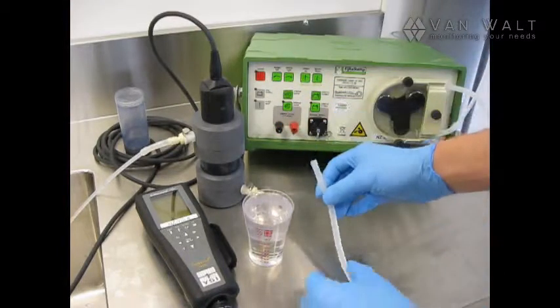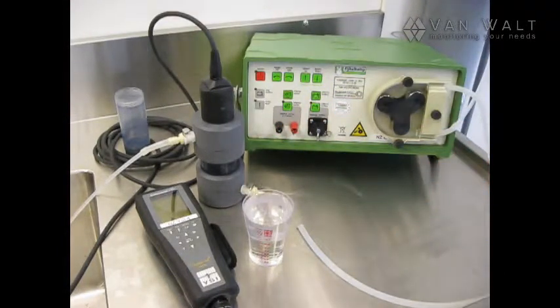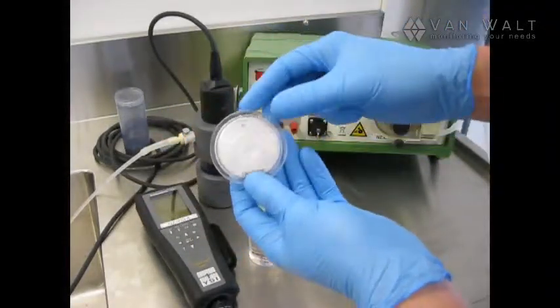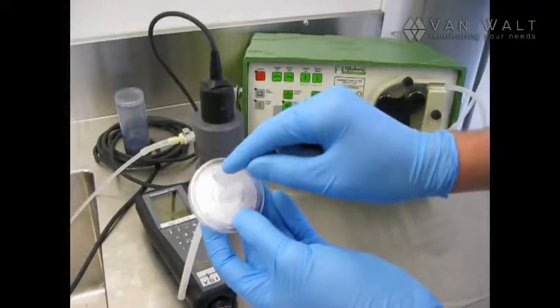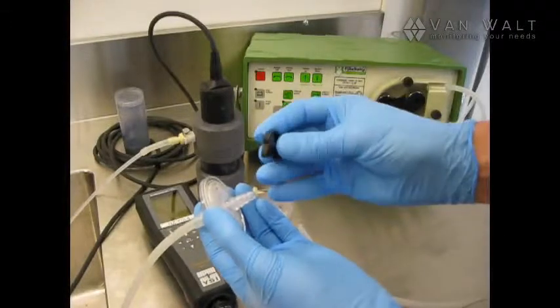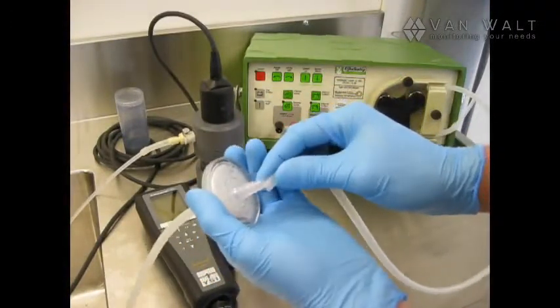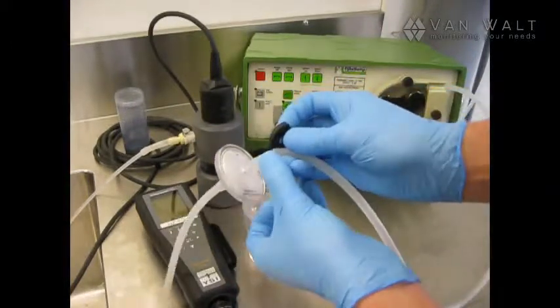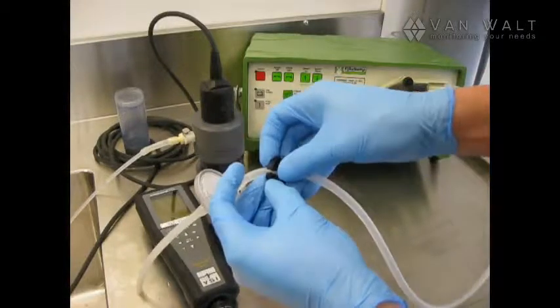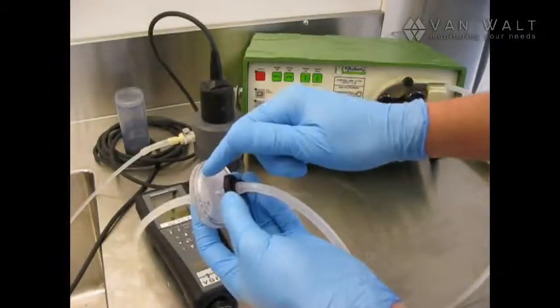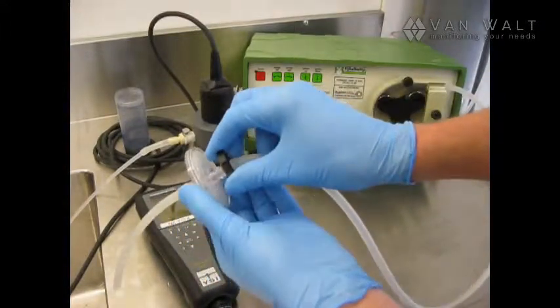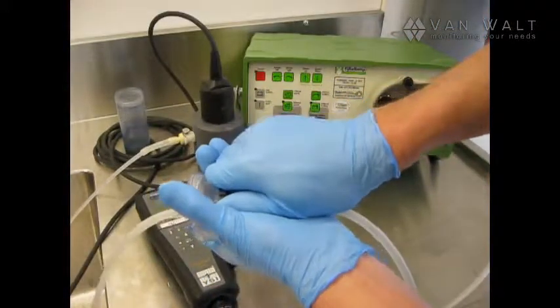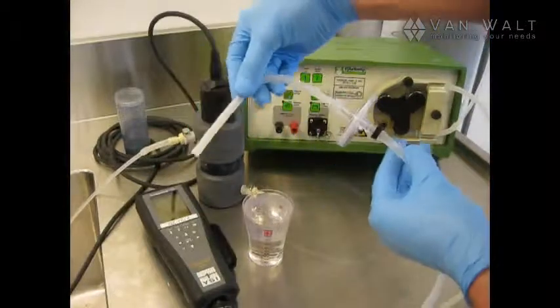And once we've done that, again we can stop the pump. And now, if we want to, we can attach our filter. I have a small disk filter here. I've already put a small length of tubing on the exit side. There is an in and an out, so be aware of that. And we've got a little tube clamp here as well. So now we can pop this on. And the clamp goes on. And the reason why the clamp goes on is this pump is capable of producing a good amount of pressure. And if this filter gets clogged, we could end up forcing this hose off and making a mess. So this clamp is going to go on. And now we're ready to take a filtered sample.